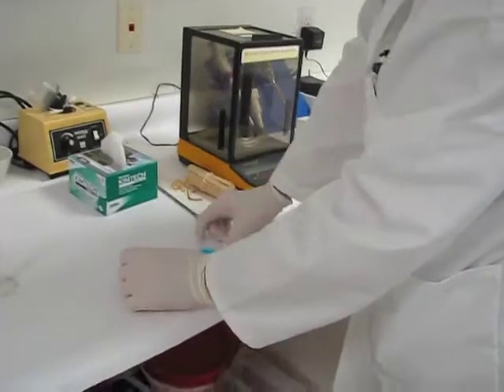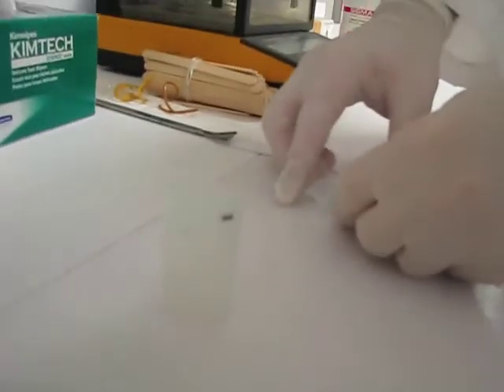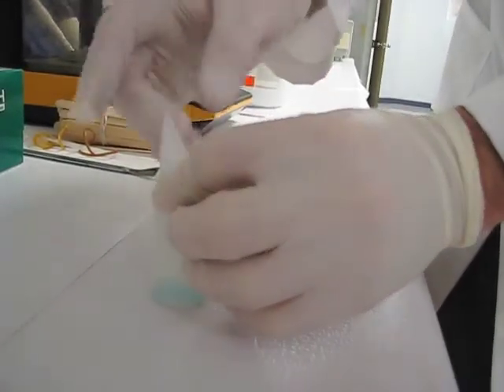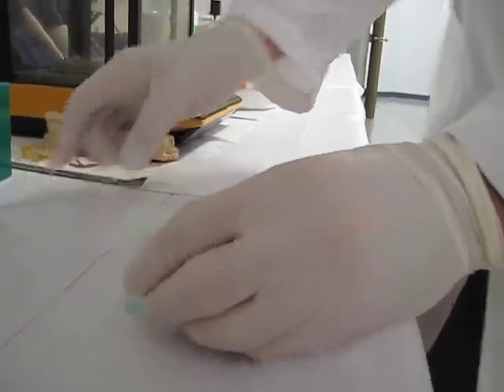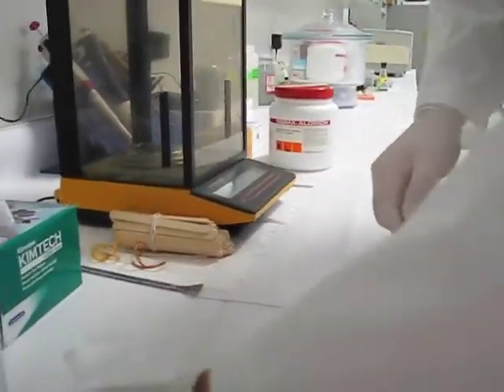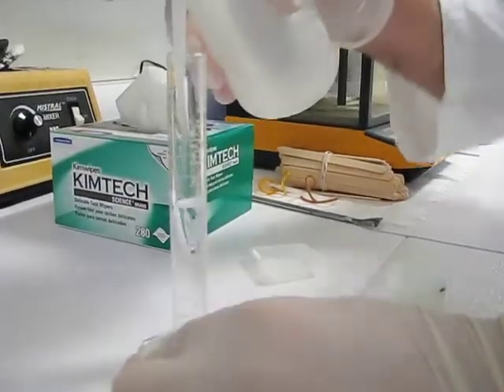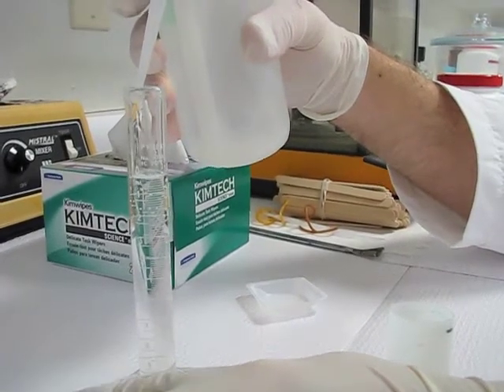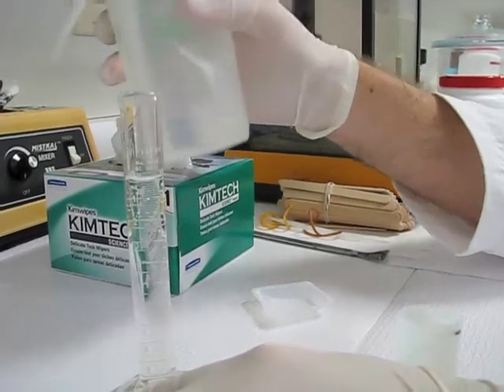I have a little vial here with a black mark, because we use these frequently to indicate where the 20 milliliter mark is. I'm just going to put this in here. Then I have a little 10 milliliter graduated cylinder here, so I'm going to do this in two steps — I will fill it 10 milliliters full first. Making sure that the volume is at the bottom of the 10 line mark, which is the meniscus — the end of the curvature. Right there.